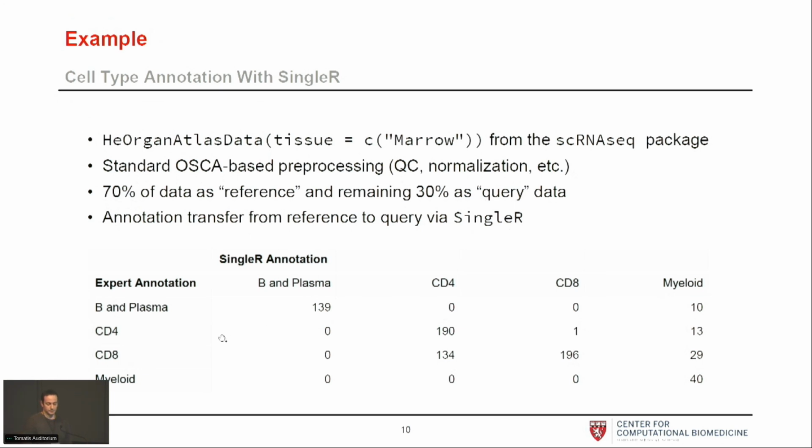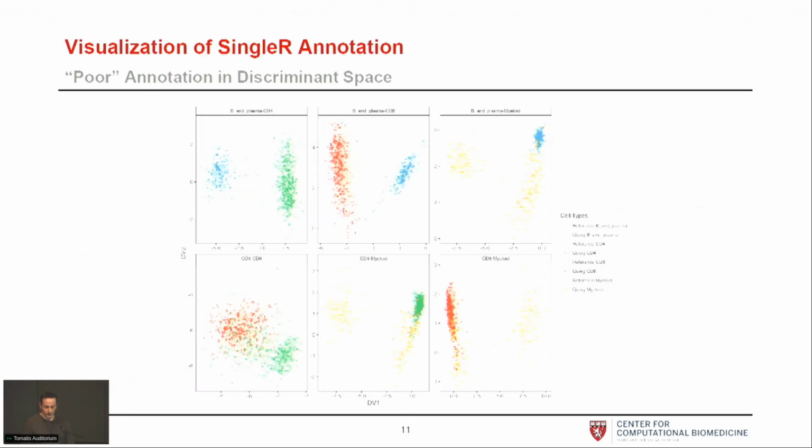As you can see, there's a lot of potential issues based on the annotation from SingleR. In particular, there's really two that pop out. The first one is there's a bunch of, according to the expert annotation, CD8s that have been annotated as CD4 by SingleR. And then also the myeloids are kind of all over the place, right? So we'll see, and I'll show it just now, again as a motivation, one particular tool that was developed for the package where you can actually visualize this, and it'll be clear what's going on.